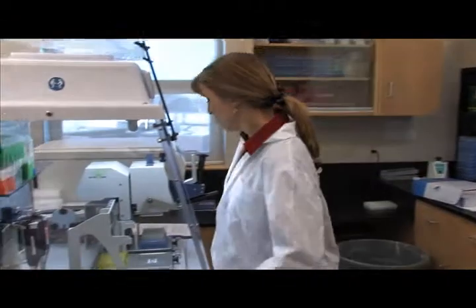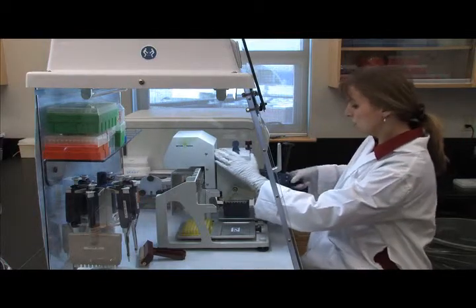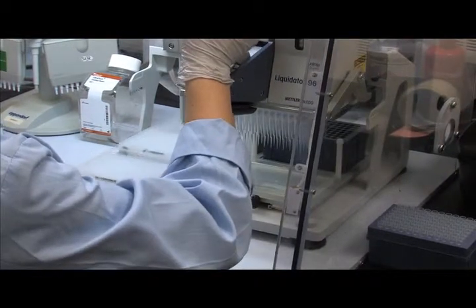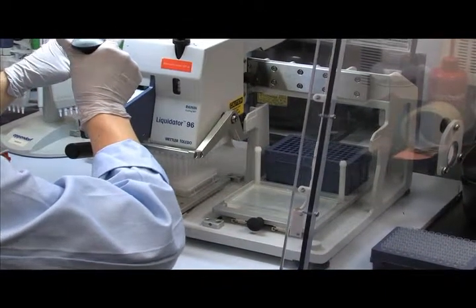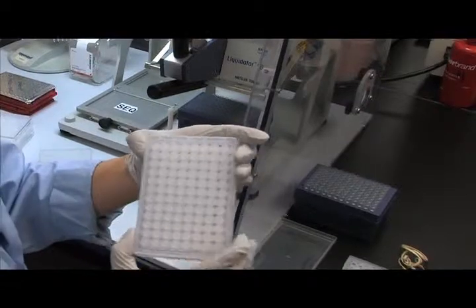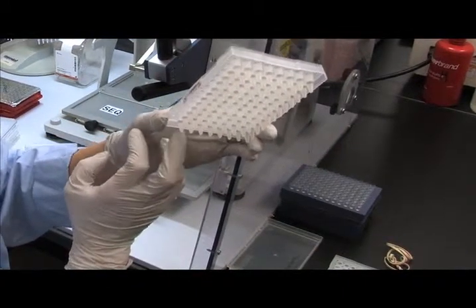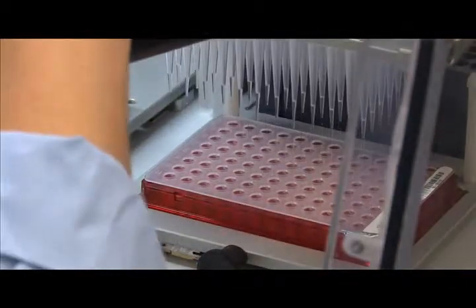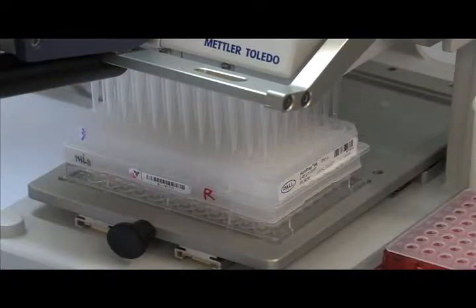The cycle sequencing PCR reaction product needs to go through dye terminator removal process before loading the sample onto a sequencer. Use 0.1 millimolar EDTA solution to collect sequencing reaction after purification. Fill collection plate with 25 microliters of dilute EDTA. For purification process, use Sephadex plate. Sephadex plates are spun in a centrifuge and excessive water collects in the collection plate upon centrifugation. Transfer entire volume of sequencing reaction product to a filter plate pre-packed with Sephadex G50 resin without touching the sides.